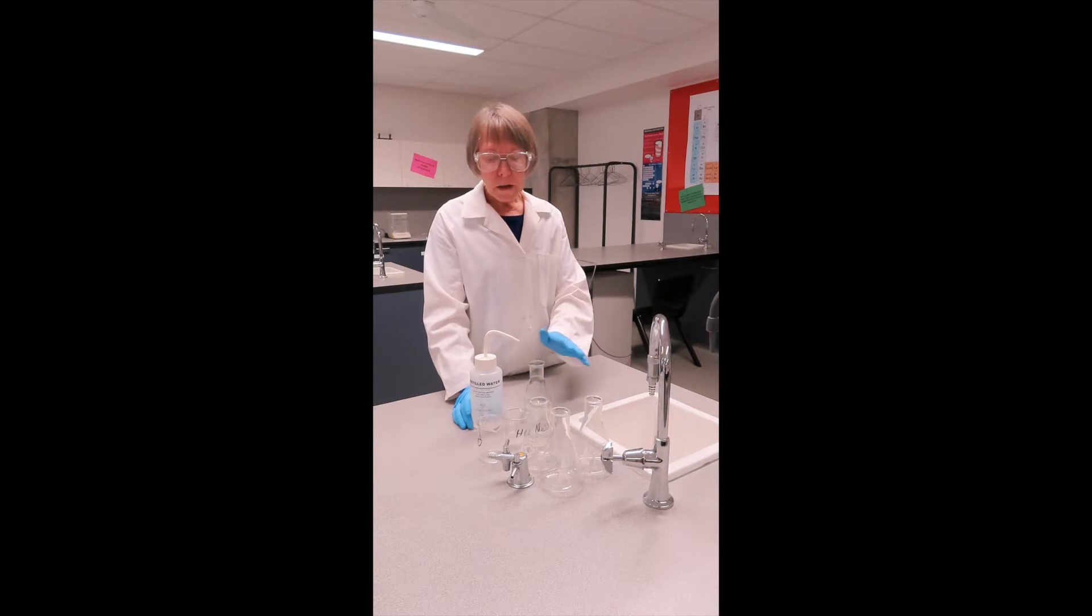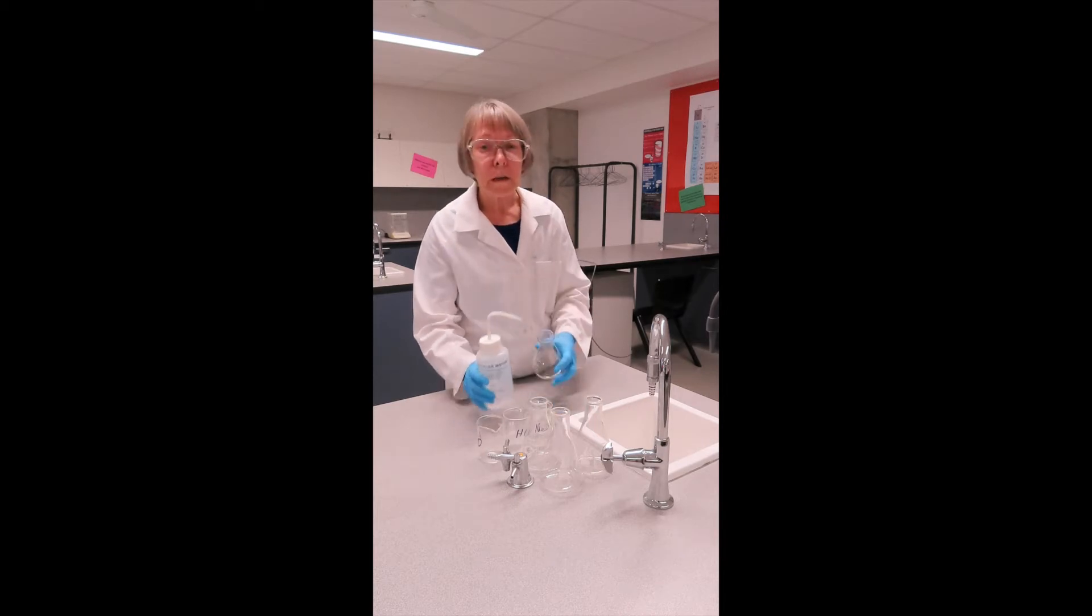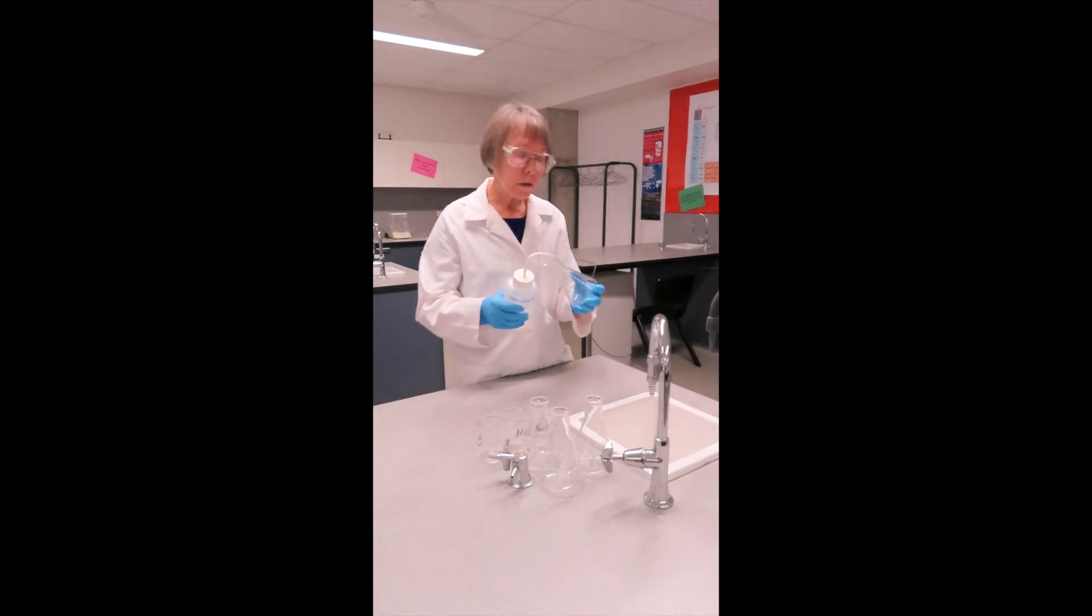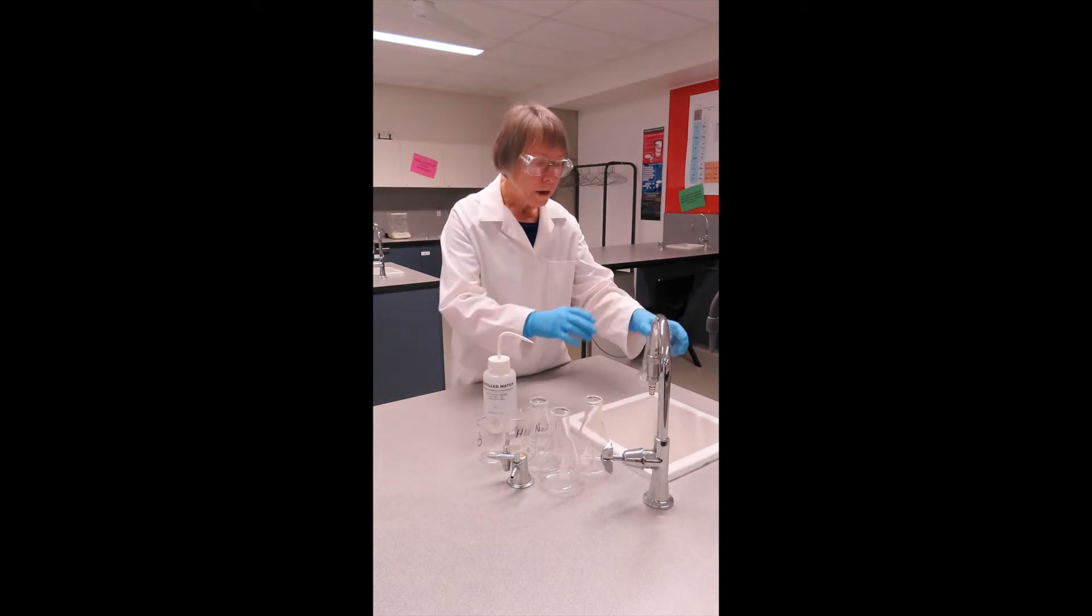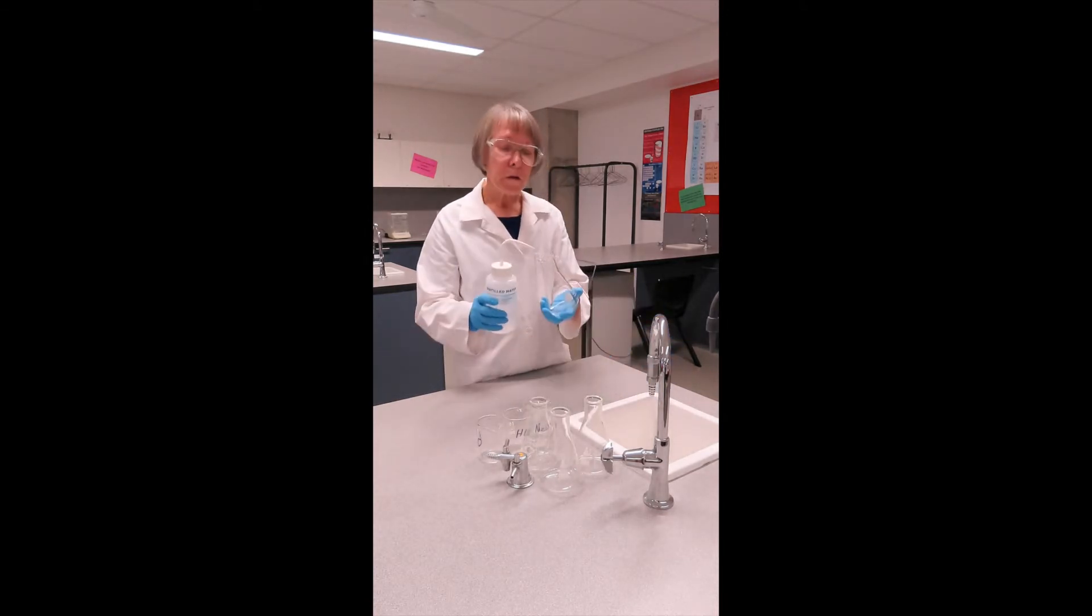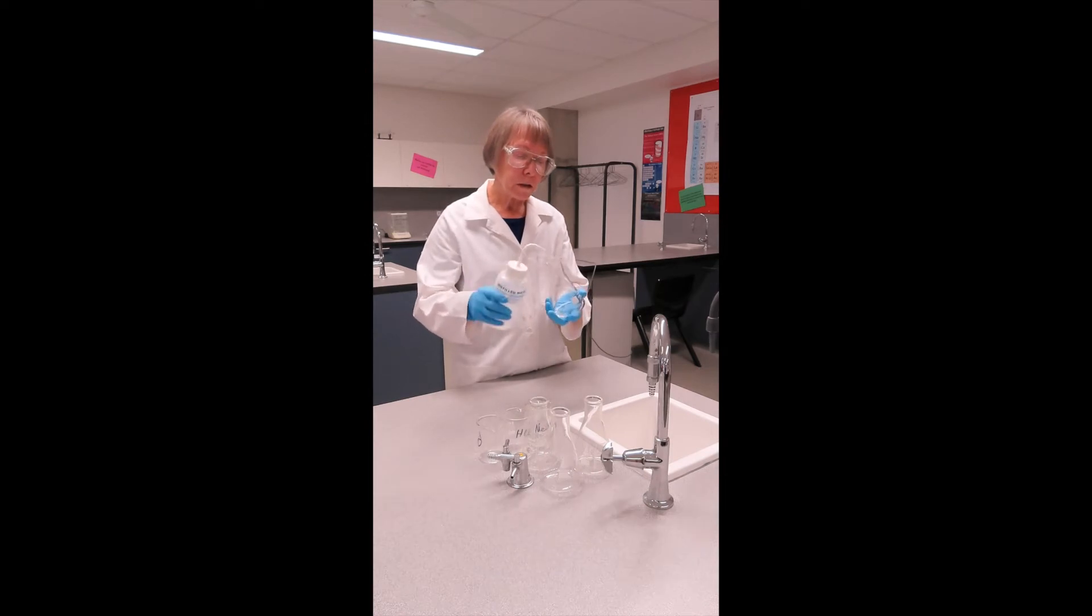Our flasks and beakers that we may use all need to be rinsed three times with distilled water. I'll show you very quickly just how to rinse your flask. A wash bottle, just a small volume. Make sure that you wash all of the inside walls and do that three times for each flask and then three times for each of your beakers.